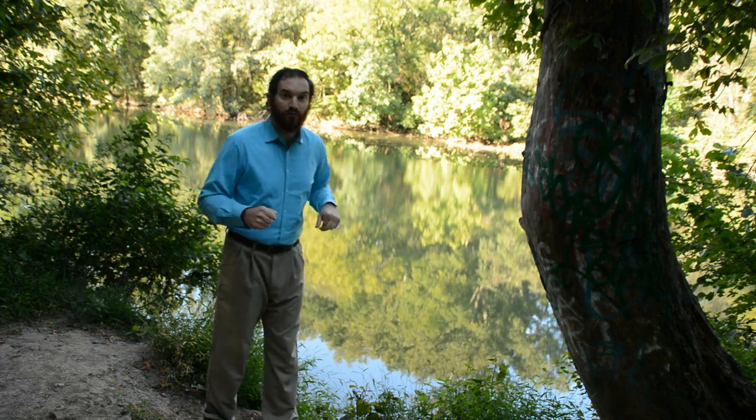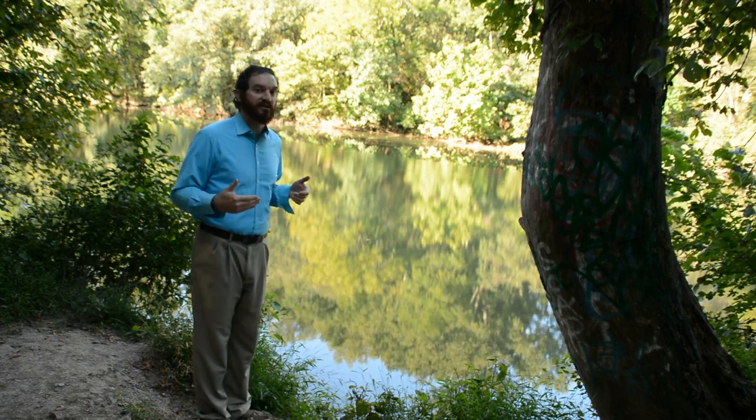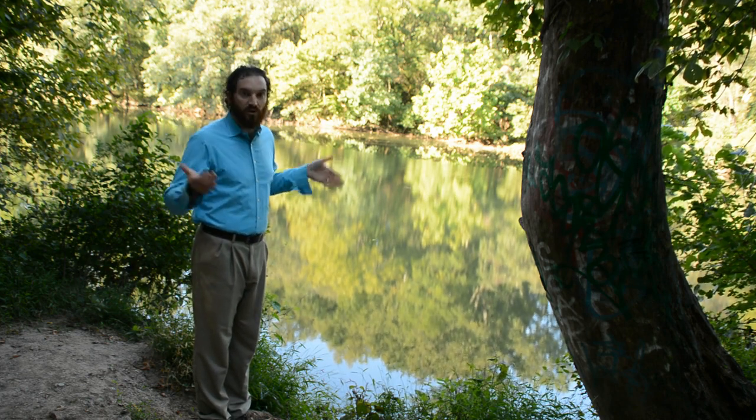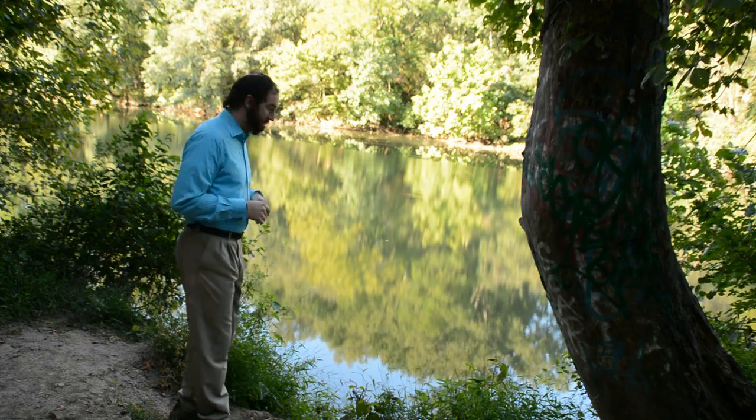Fingers crossed. Hopefully everything went well. The experiment seemed to have perfect conditions. This is ideal conditions. 24 hours of just no clouds, plenty of sunlight, nice cool temperatures. Hopefully we'll see what we want to see.